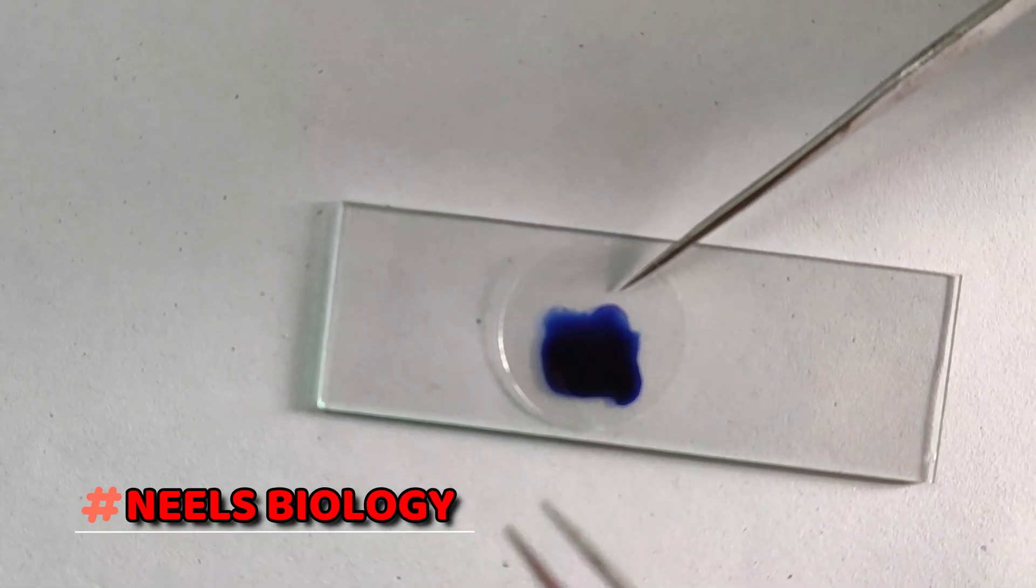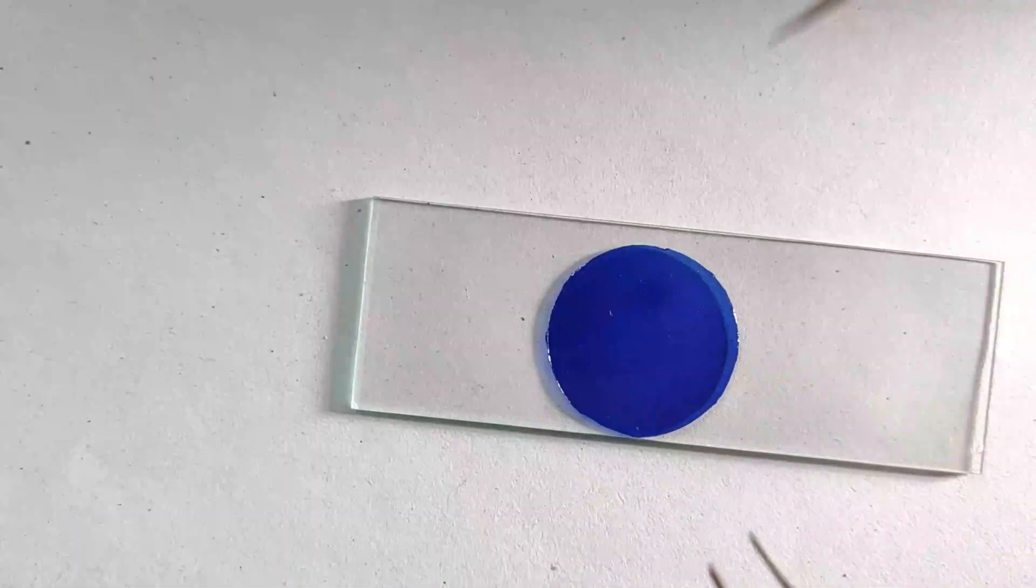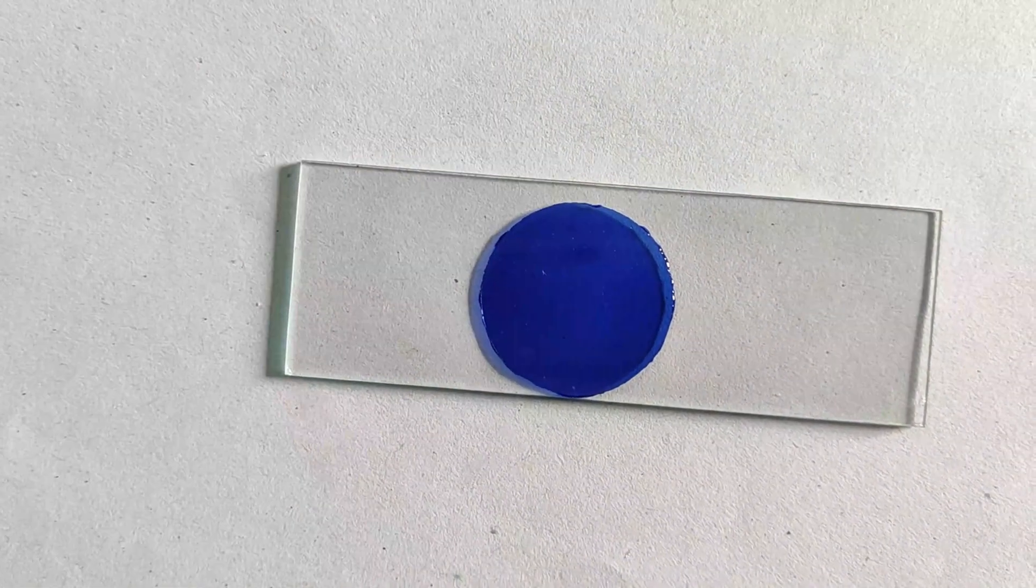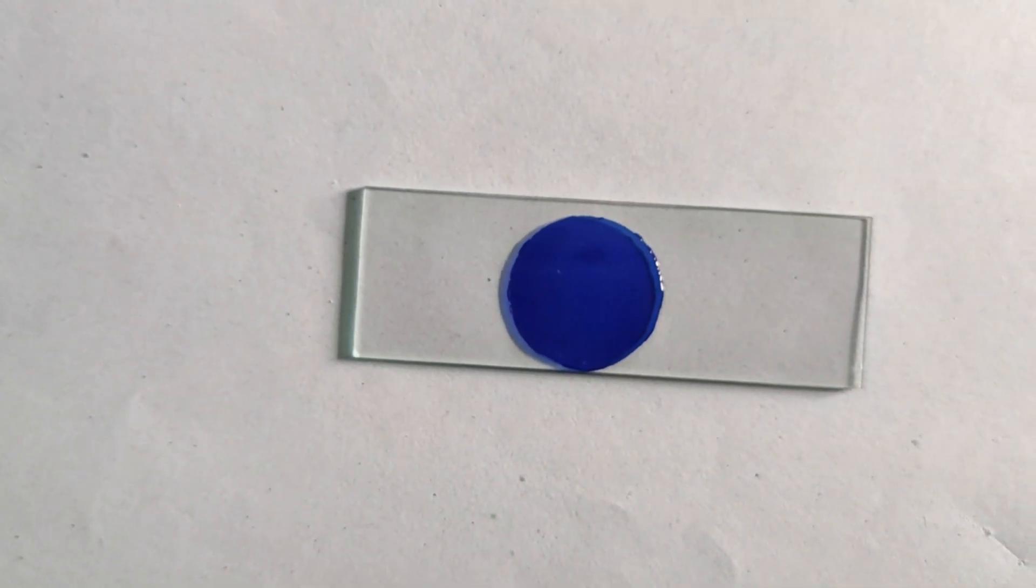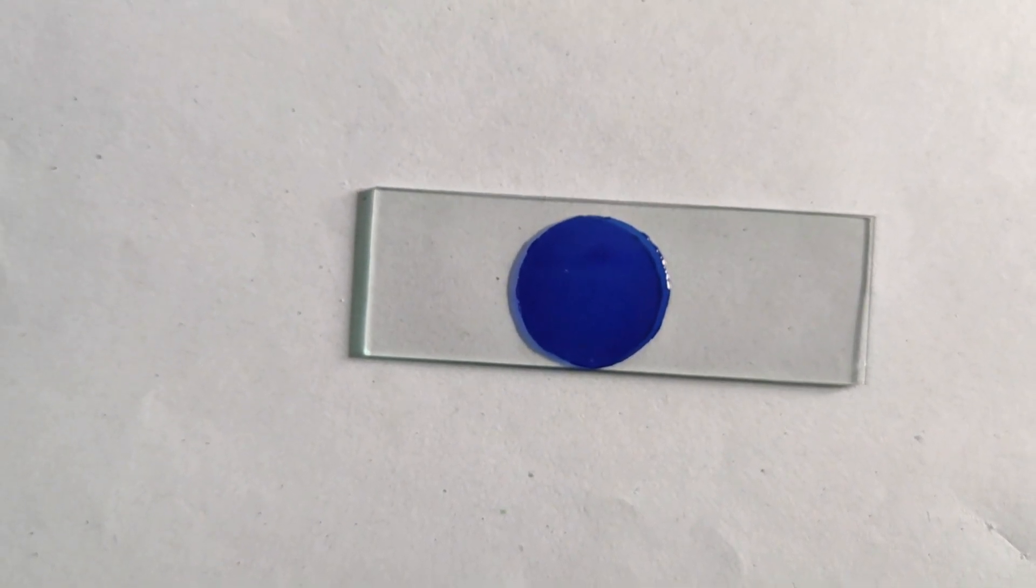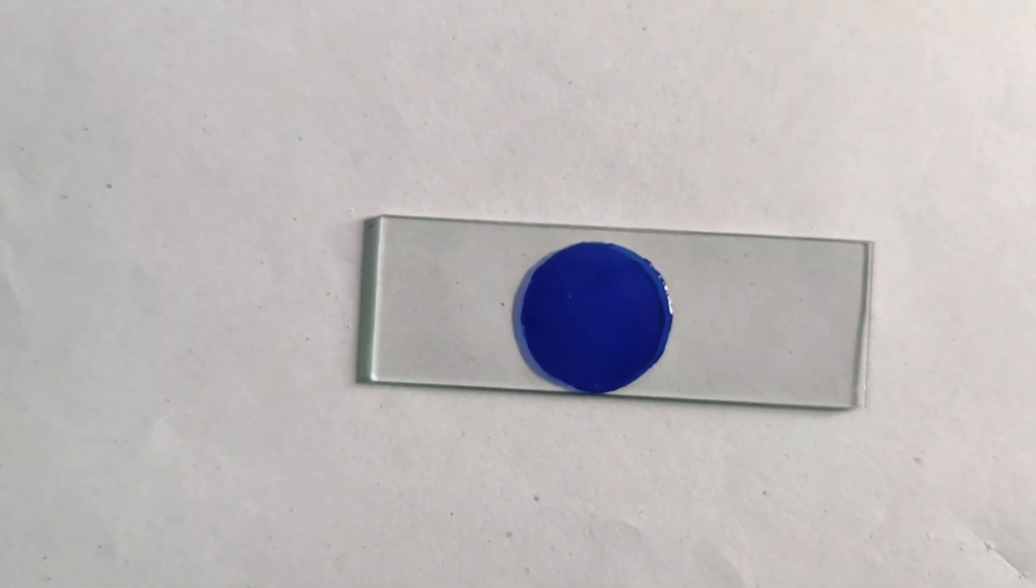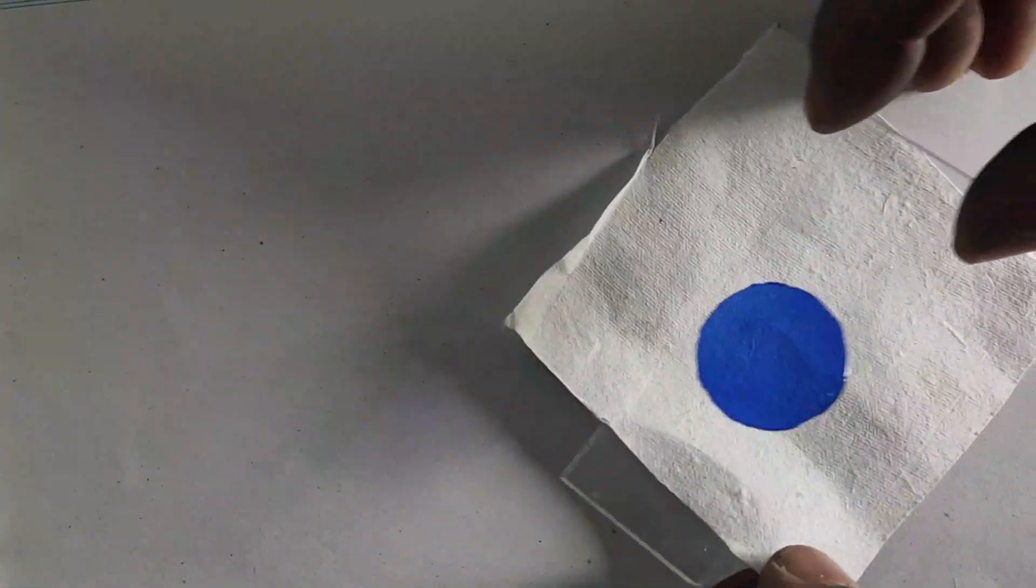Keep in mind to place it very gently and slowly so that there is no air bubble in the slide. Then we will wait for two minutes.